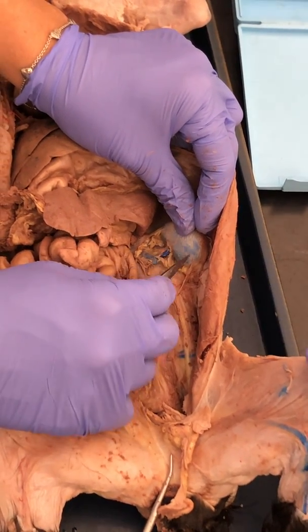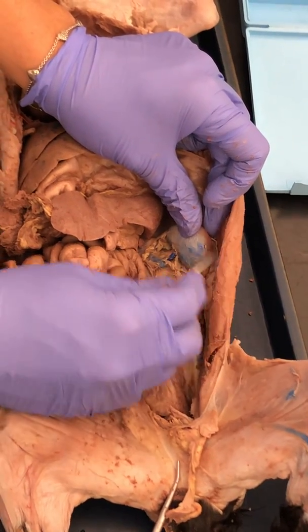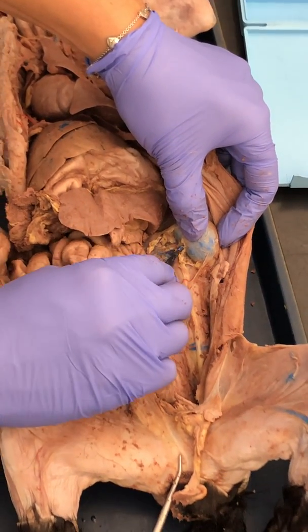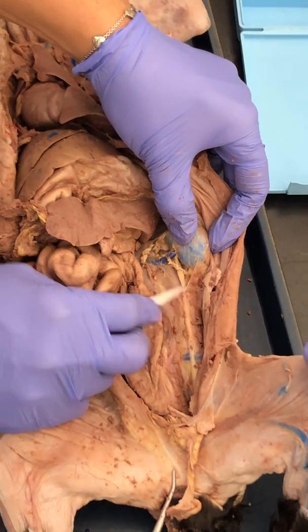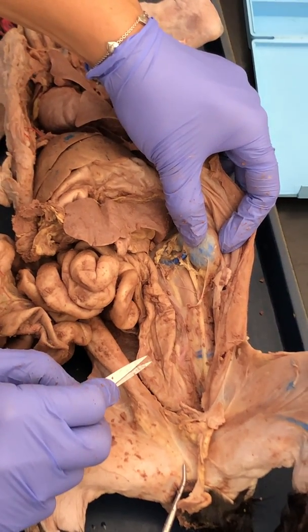Okay. When you cut the kidney open, you'll see that there is a layer of tissue right on it. That would be your renal capsule. You have the renal artery coming in. Okay, that's on top. The renal vein coming out. And then you have this guy right here, this white vessel. That's your ureter. You can follow the ureter all the way down, and it will eventually connect to the bladder.